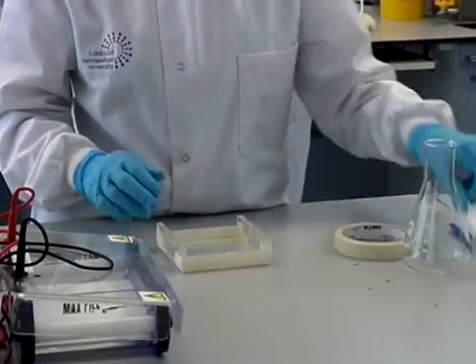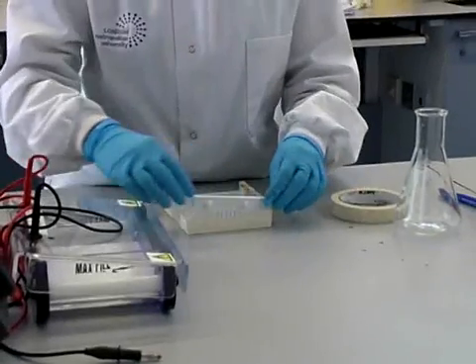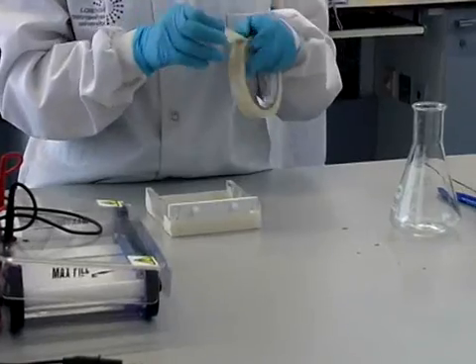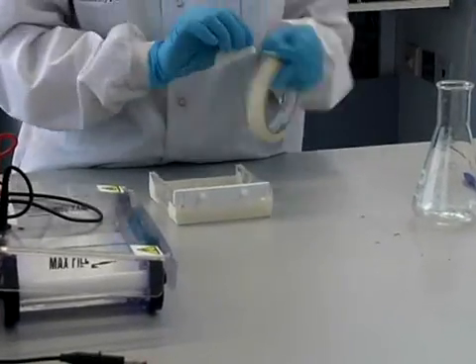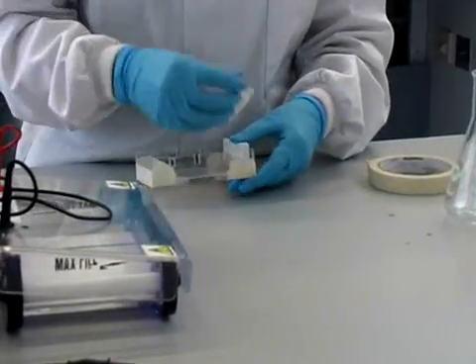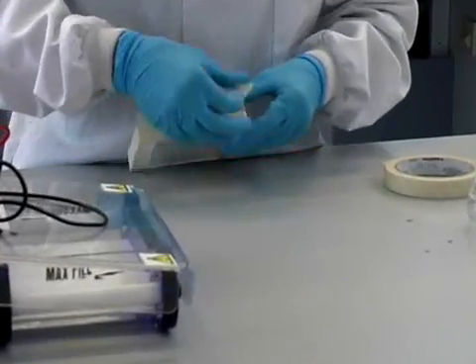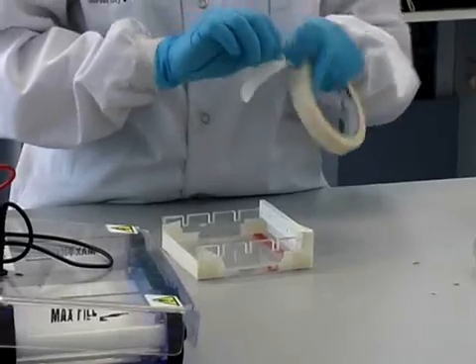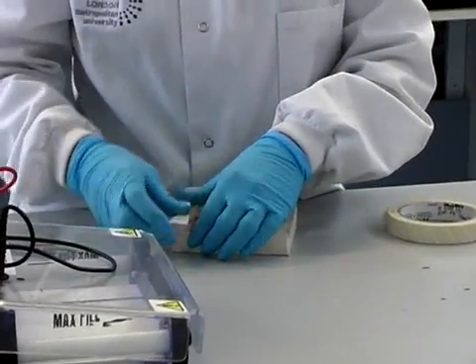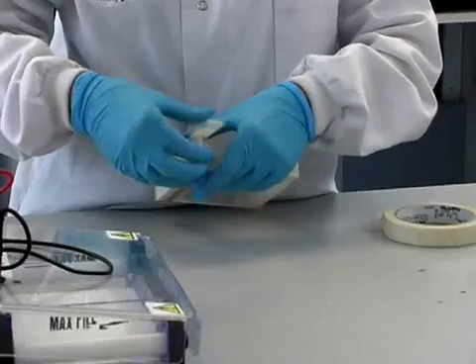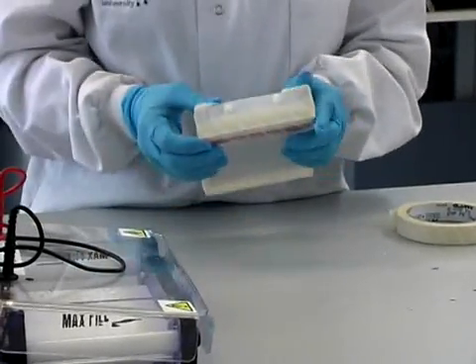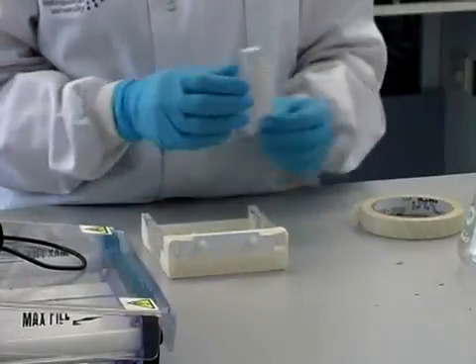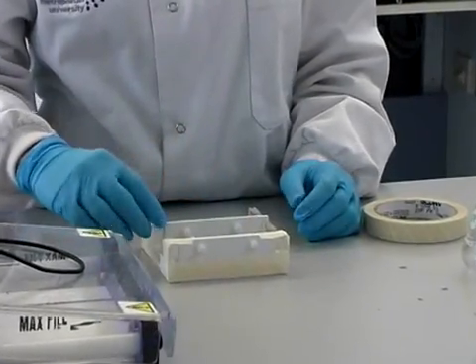The gel former is now ready to have agarose gel added. The comb is present to produce 16 wells in the gel and is taped into position. The gel former has grooves along its length, so you can add another comb of 16 wells if you have more than 16 samples to prepare.